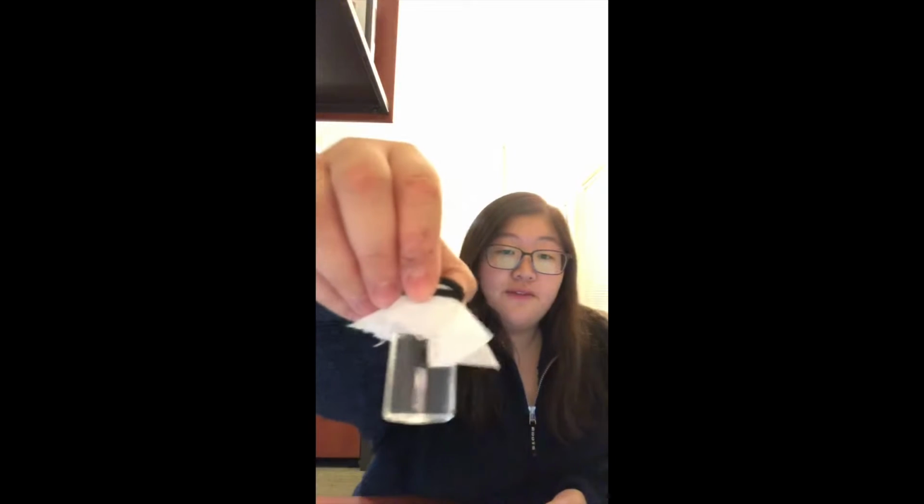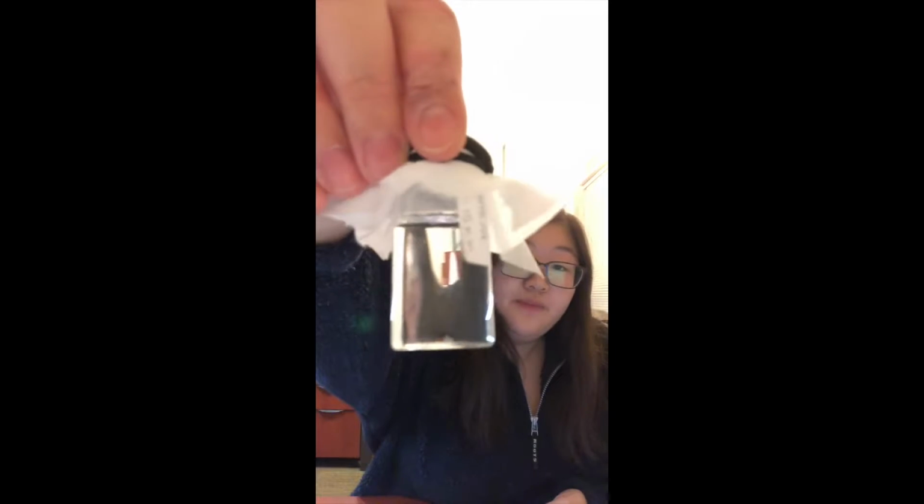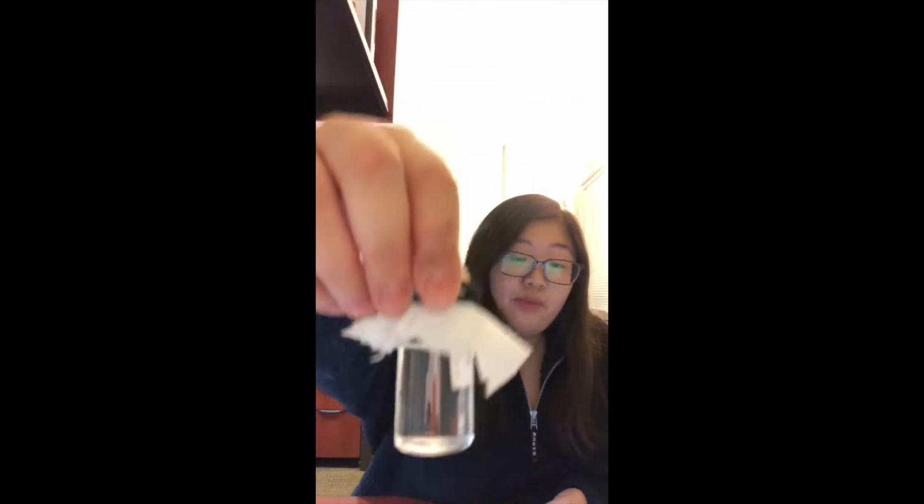As you can see for our crystal, as of now, I do not currently have any crystal growth in my vial, but it can be observed that a significant volume of the water has evaporated from the vial. Therefore, in comparison to the last alum video, there has not been a significant change in crystal growth.